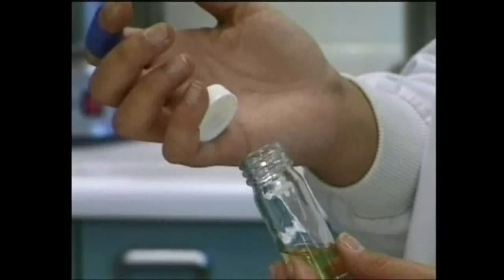This is difficult at first, but becomes easier with practice. It is a good idea to loosen bottle caps before work starts, because this makes handling the bottles easier when carrying out aseptic techniques.